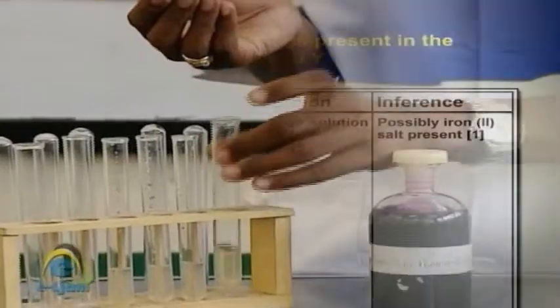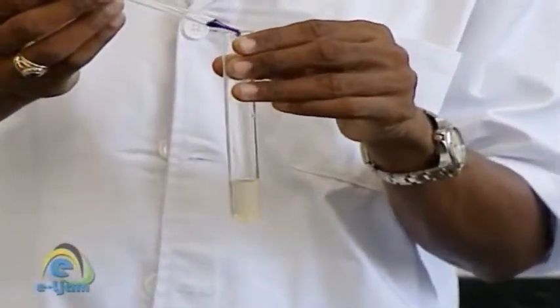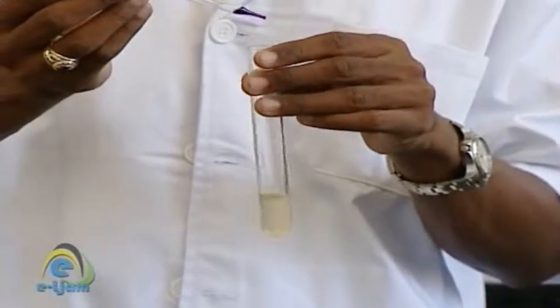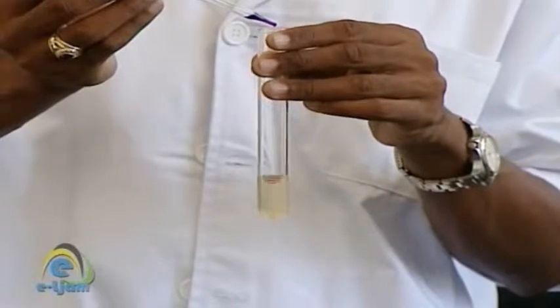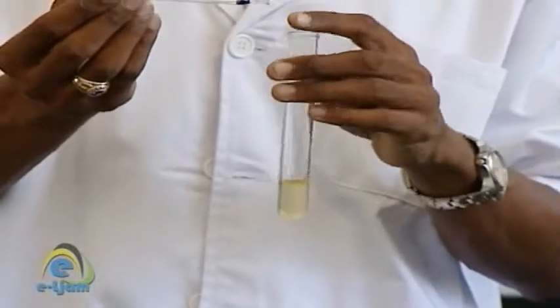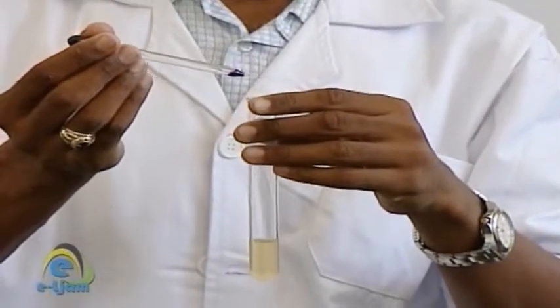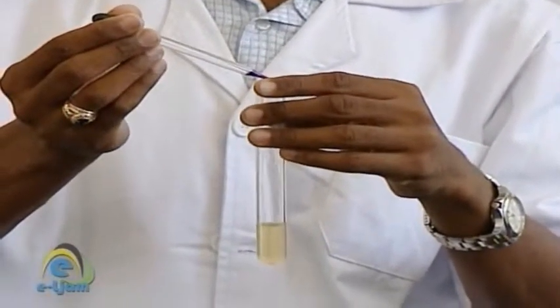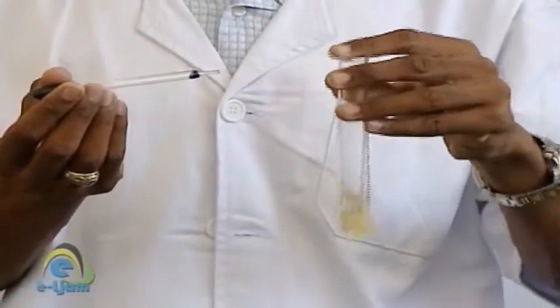To the first portion, add a few drops of acidified potassium manganate(VII). Observation: decolorized acidified potassium manganate(VII). Inference: reducing agent present. Observation: yellow solution formed. Inference: possibly iron(II) being oxidized to iron(III).